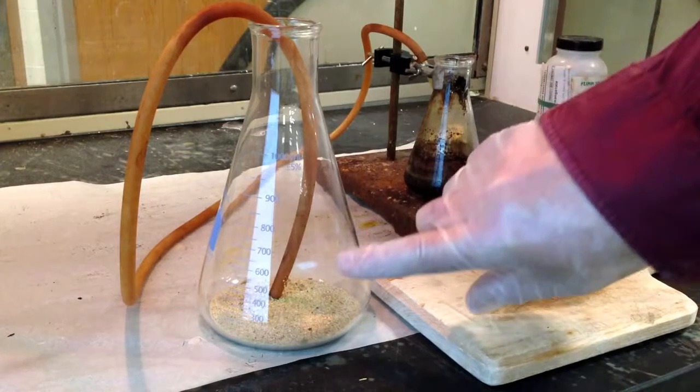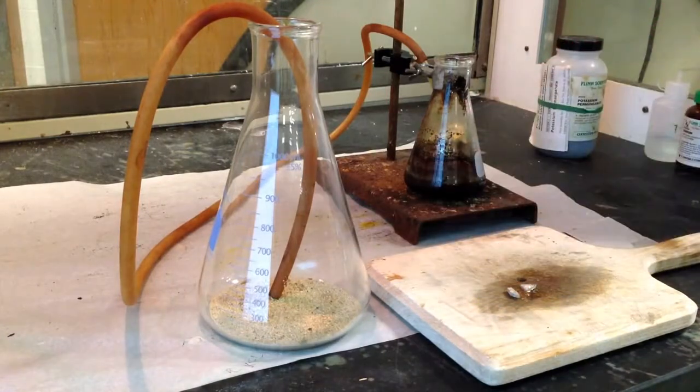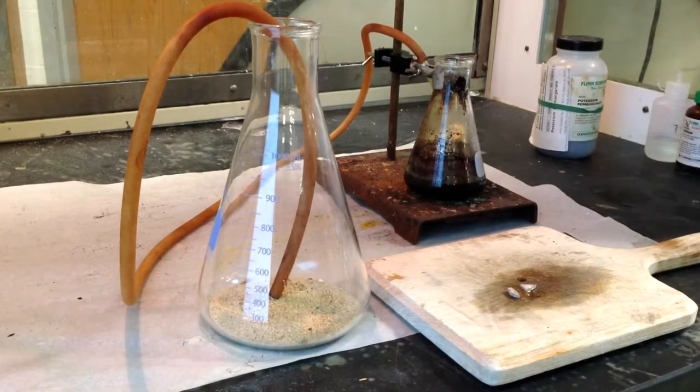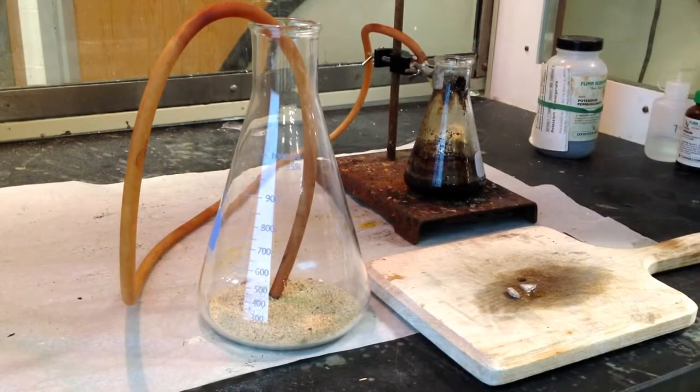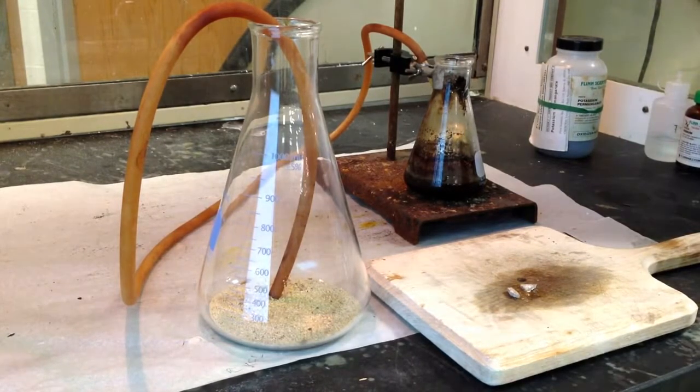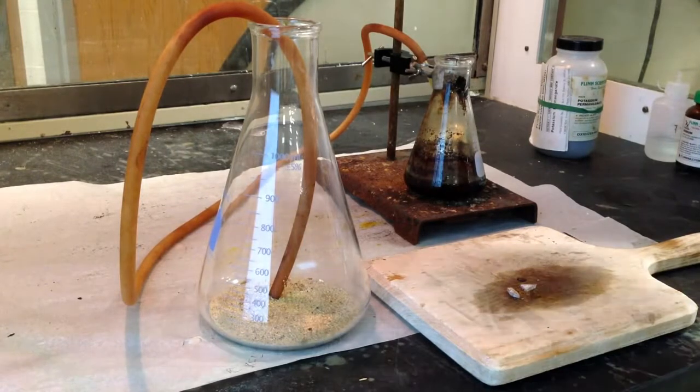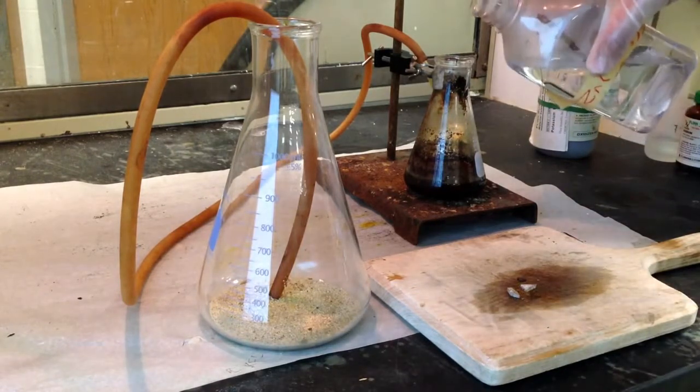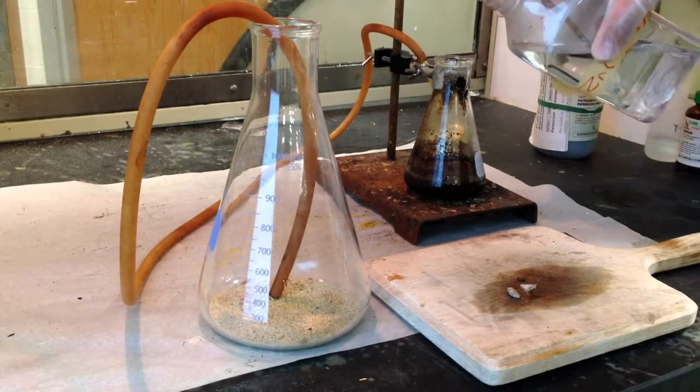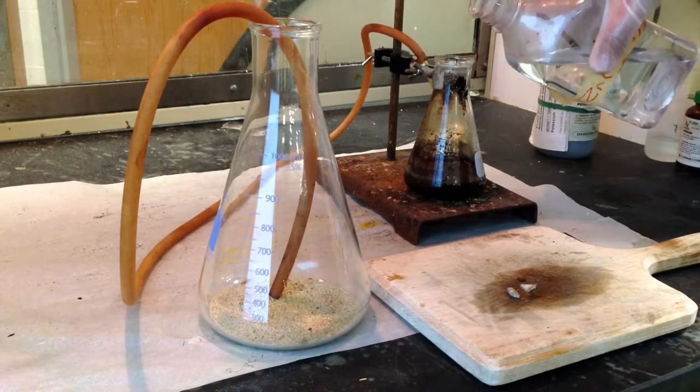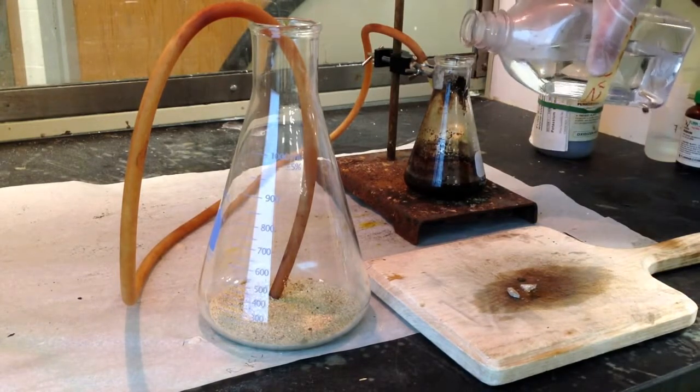There's a little bit here that I made previously, but I'm going to pump it up, or pump up the volume, so to speak, with some hydrochloric acid. So it's the chloride ions reacting with the permanganate ions, and the chloride ions, being Cl-, are going to lose the electron, be forced to oxidize by the presence of the oxidizing agent, the potassium permanganate, or the permanganate ion, to make your chlorine gas. So let's make some chlorine gas.